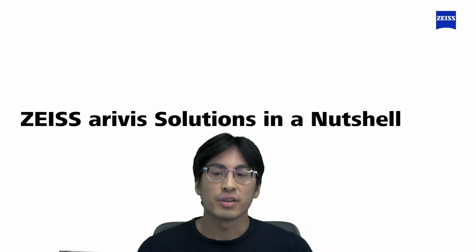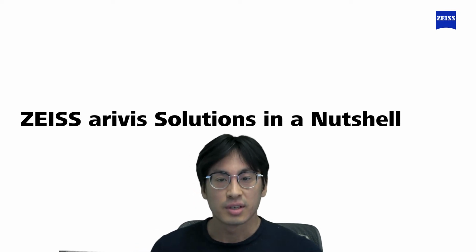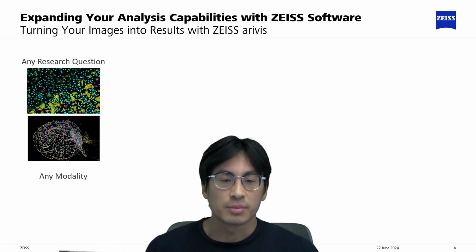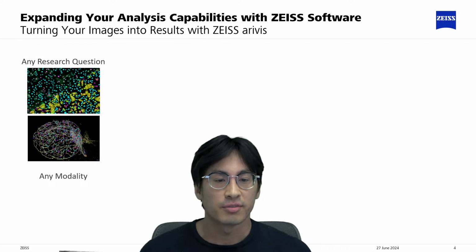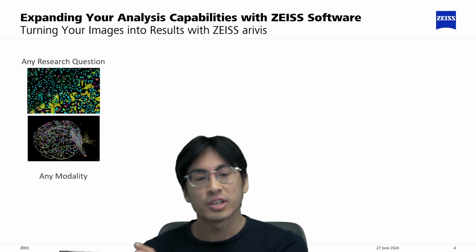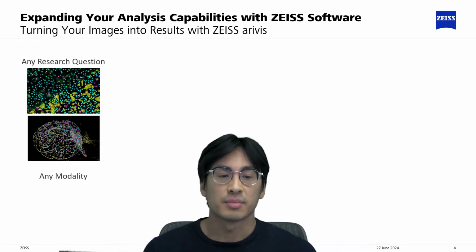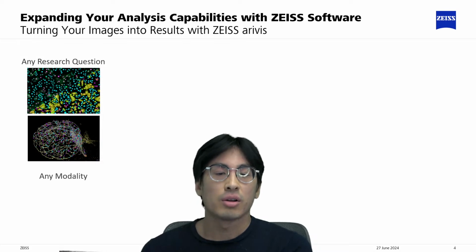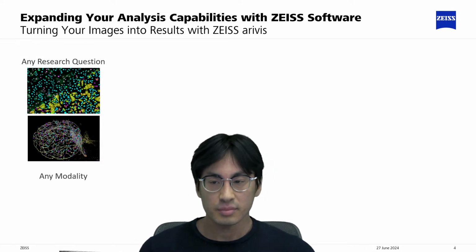So I'm going to give you a brief overview of what our ZEISS arivis solutions has in store for you. arivis is a flexible software, meaning that it is able to take in over 50 different imaging file formats and lets you analyze any images from the scale of organisms all the way to puncta in any different modalities, such as wide field all the way to lattice light sheet dealing with big image data.